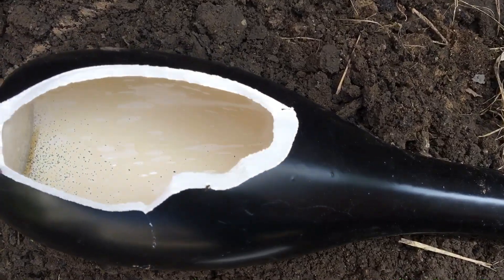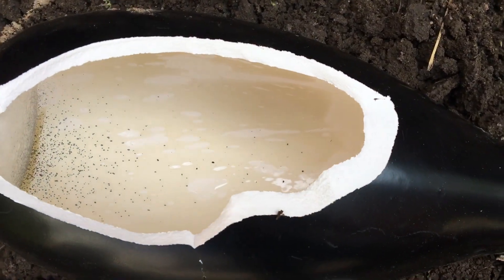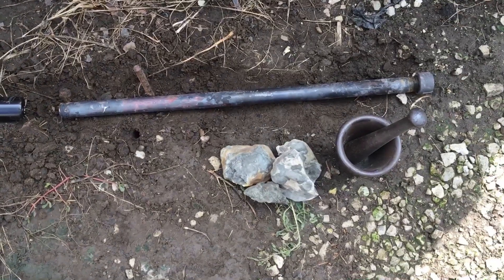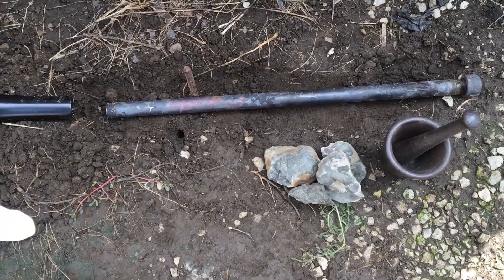The elemental sulfur should condense in there. I don't know if this will work — I saw it in an old chemistry book that I have, so I'll give it a shot.